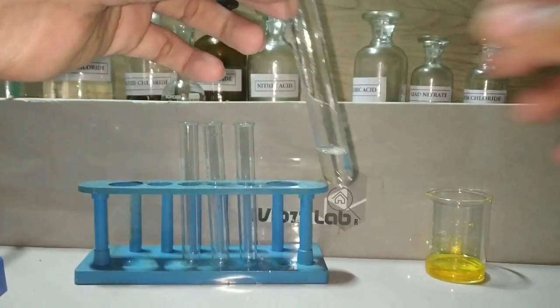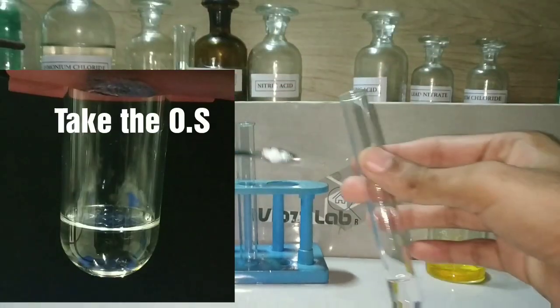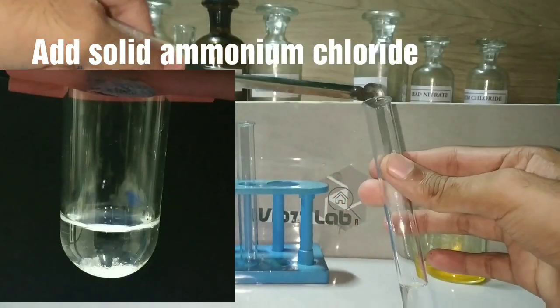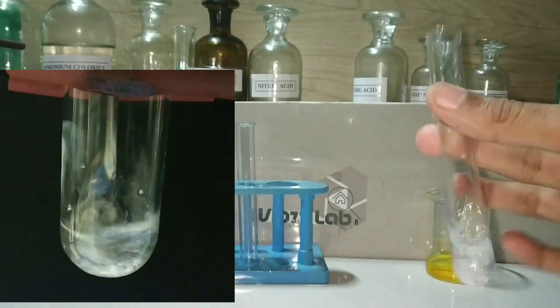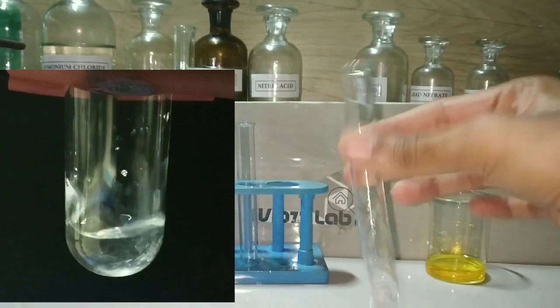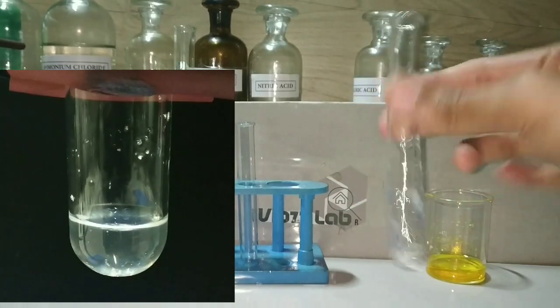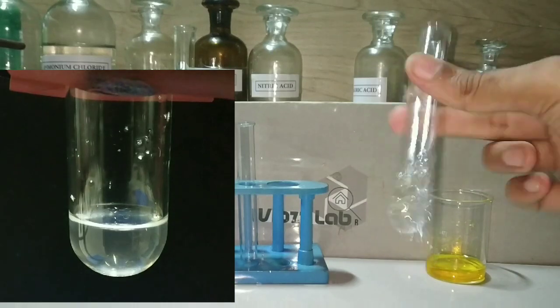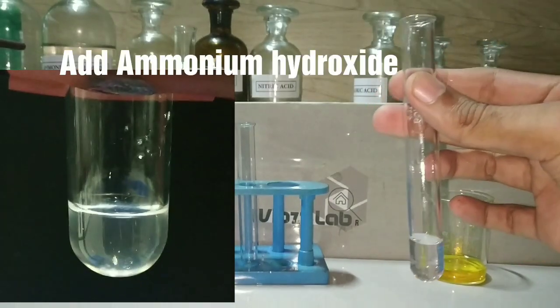First, we have prepared the original solution — the salt dissolved in distilled water. Into the original solution we add solid ammonium chloride and mix to dissolve. Next, we will be adding ammonium hydroxide.